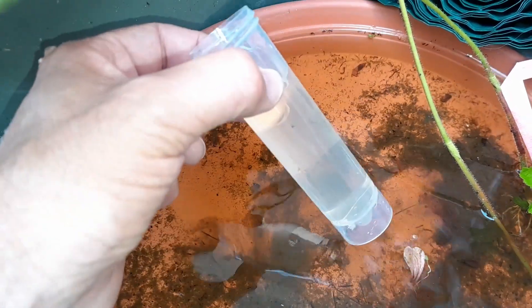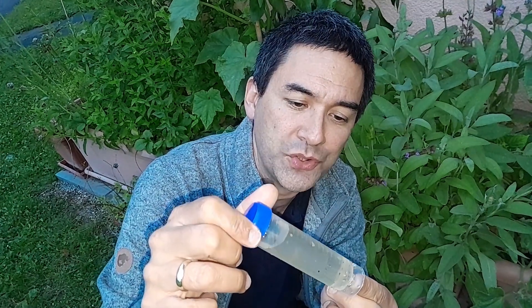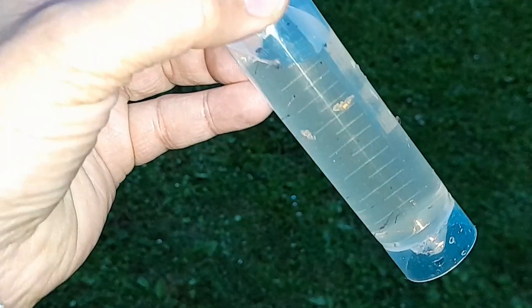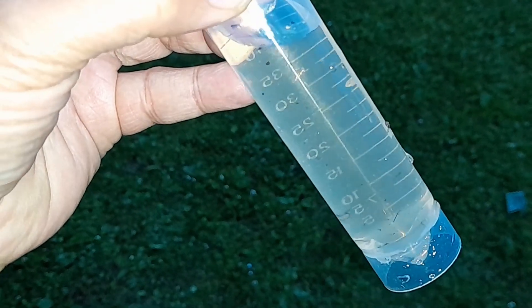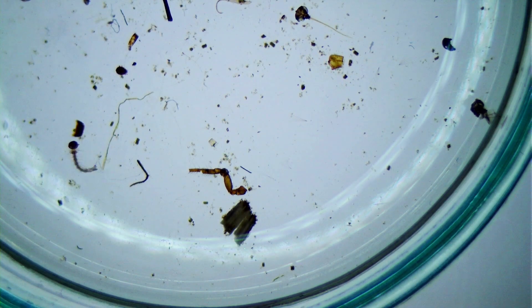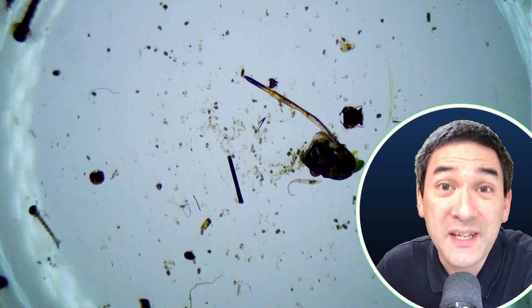There's quite a bit of movement in here — maybe 20 or 30 mosquito larvae. I caught quite a few, actually. Mosquitoes are considered to be the deadliest animal worldwide. Over 700 million people are infected every year with diseases transmitted by mosquitoes, and around a million people die every year because of mosquito-borne diseases.